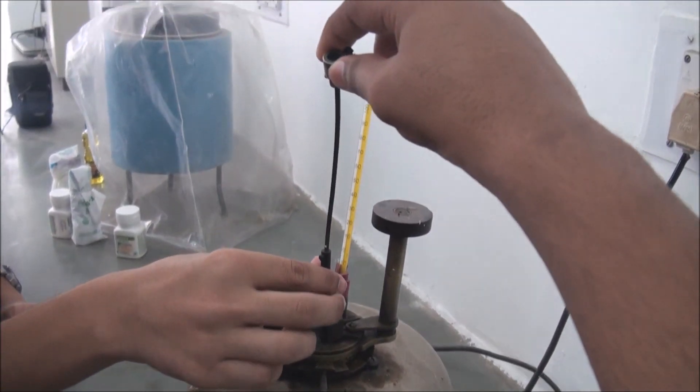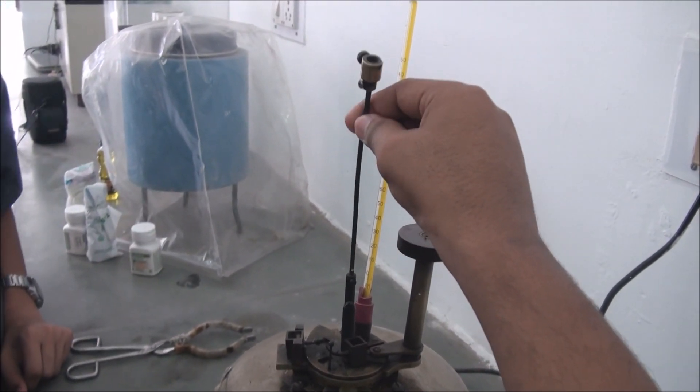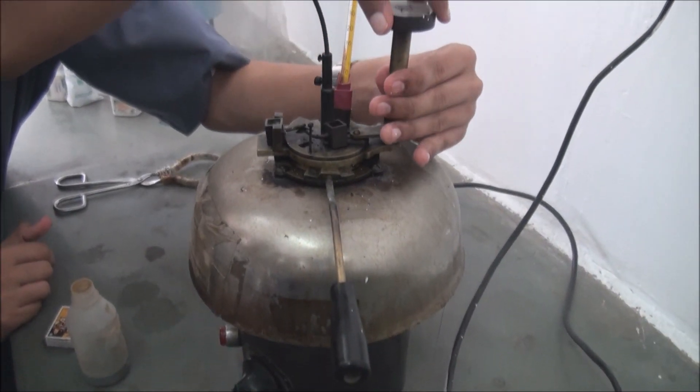The working of the stirrer is shown in the video. Also, the openings for the flame are shown.